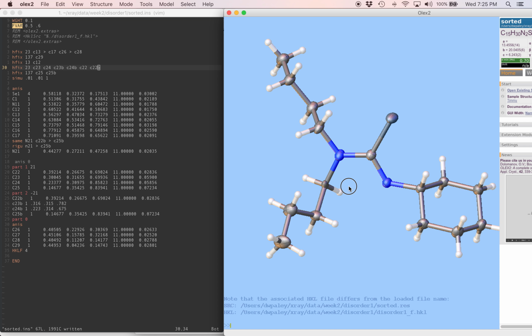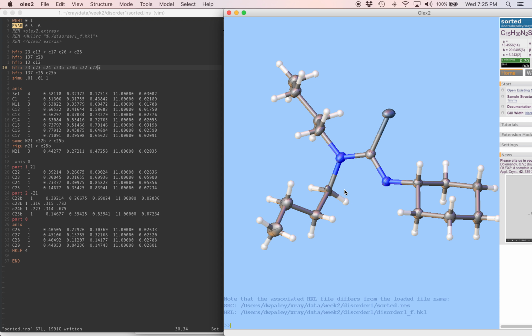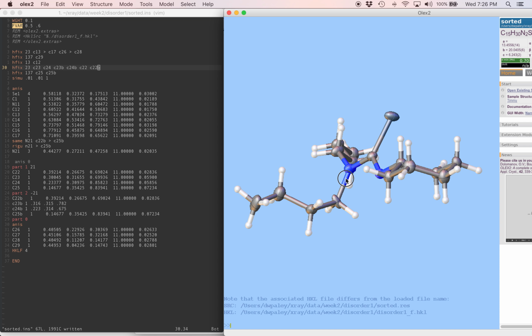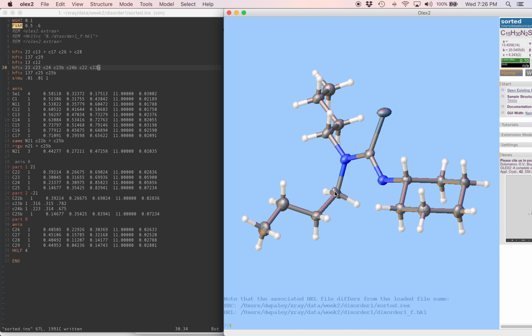In this second disordered part, the displacement parameters for this first disordered atom look a little strange. It's not so unusual when an atom is, one, closely overlapping with another atom, and two, when the occupancy is pretty small. It's 34% occupied, so that means we're looking at a total of 2 electrons on this position. And that's not enough to define the displacement parameters very accurately. So it's not such a big surprise that it's a little weird here.